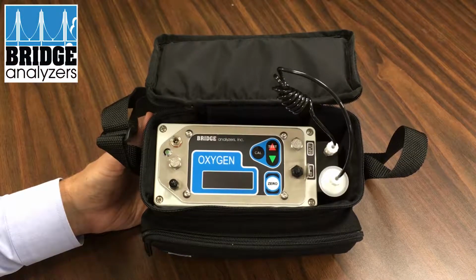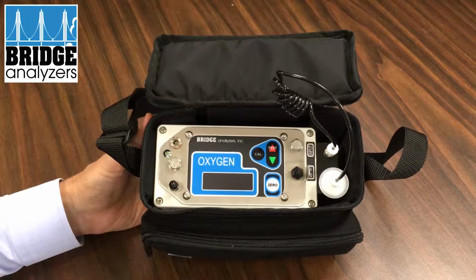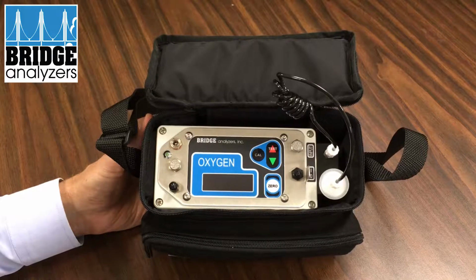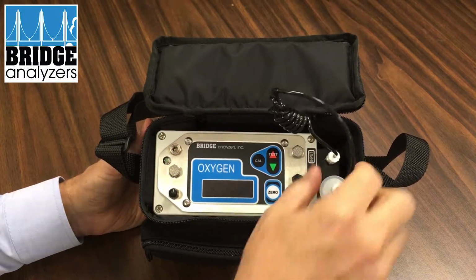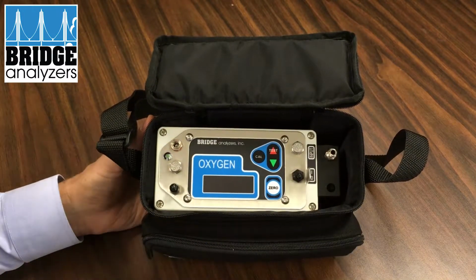In this video, we're going to show how a user can replace the oxygen sensor on a bridge analyzer, MAP analyzer. So you want to make sure the analyzer is turned off, which is this switch here. And then we're going to remove the sample line and sample needle.